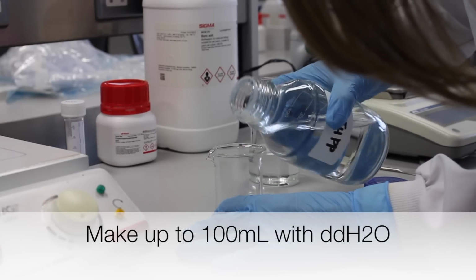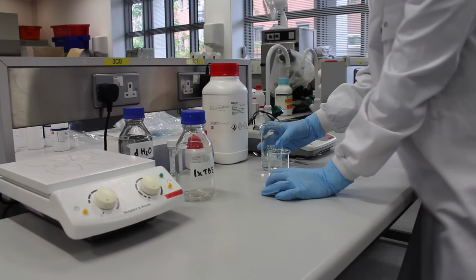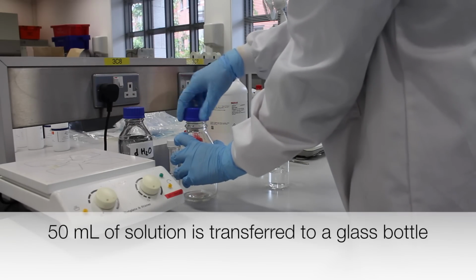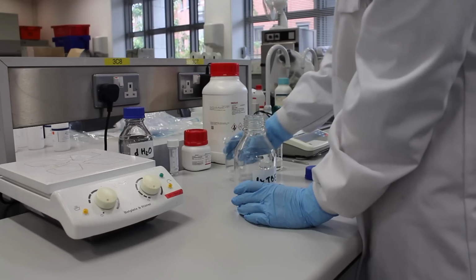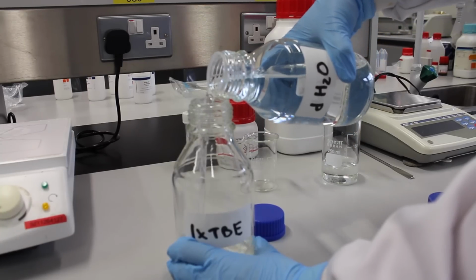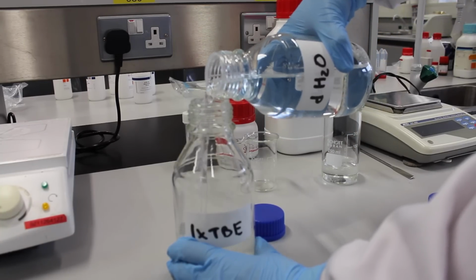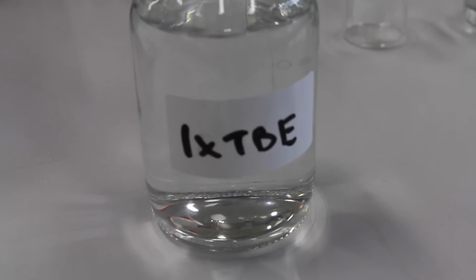20 milliliters of water is now added to make up the final volume of 100 milliliters. 50 milliliters of this solution that has now been made up is transferred to a properly labeled glass bottle. The solution is diluted times 10 with water so that the final volume in the bottle is 500 milliliters. TBE buffer has now been made. It is stored at room temperature in the glass bottle.